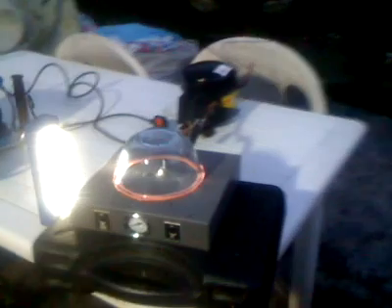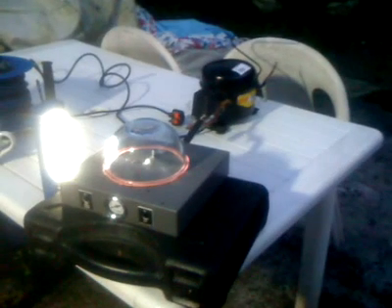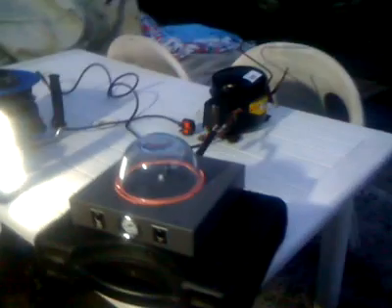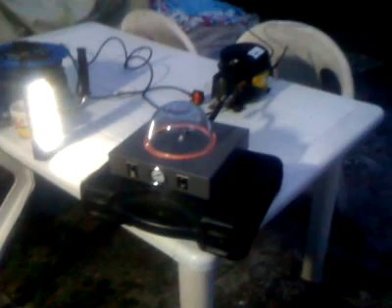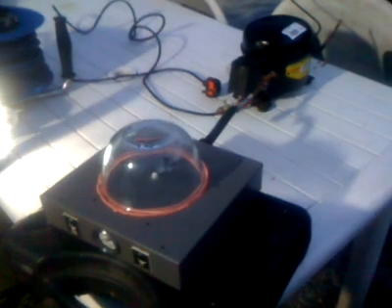As I say, it's not quite pulling enough vacuum to do the whole freeze-drying thing, because I think we want to be able to boil water visibly much quicker than that. Seeing other YouTube clips, you can see how almost explosively the water boils with an industrial vacuum pump. So I think two of these in series, which I've heard a lot of people online talking about, from the outlet to the inlet on the next one, and let them work in series, should do the trick. I'll post an update as soon as I know whether that works.